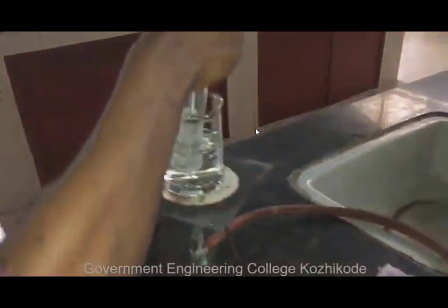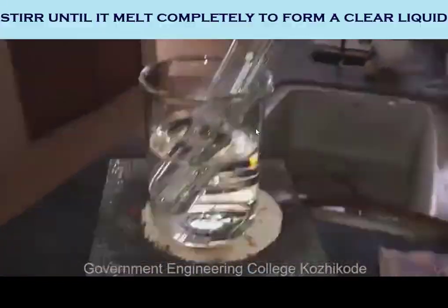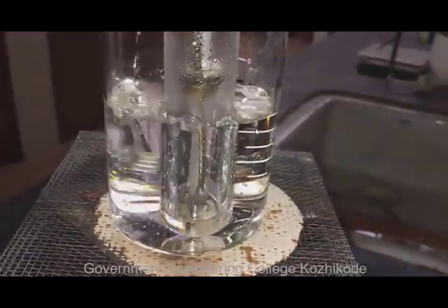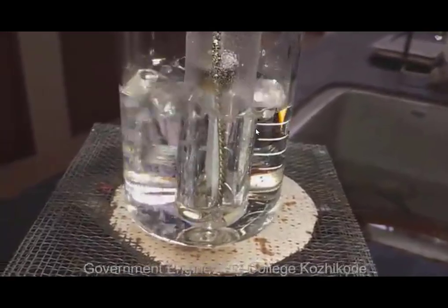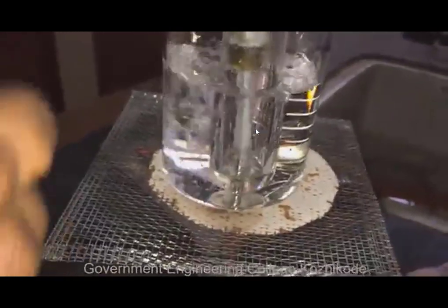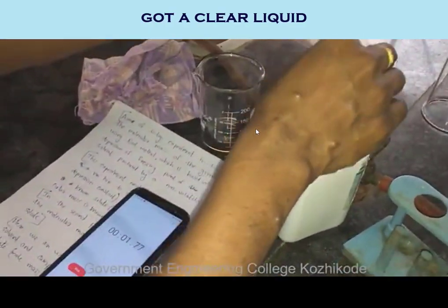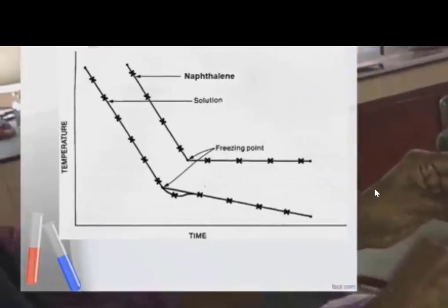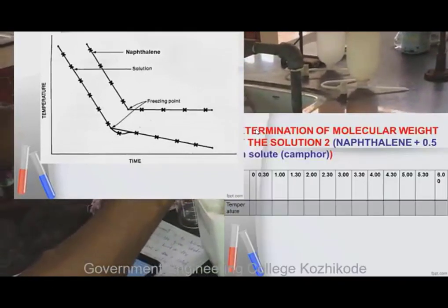It is placed on a water bath. When the solution completely melts it is taken out from the water bath and placed in an air jacket. The temperature is noted every 30 seconds as we did previously. In order to plot a cooling curve, this process is continued for a few minutes.